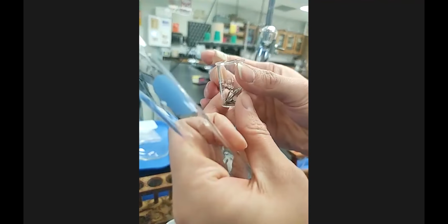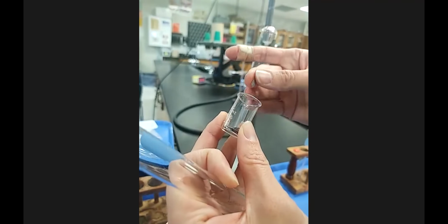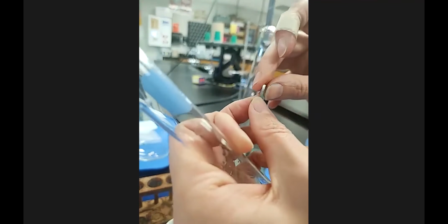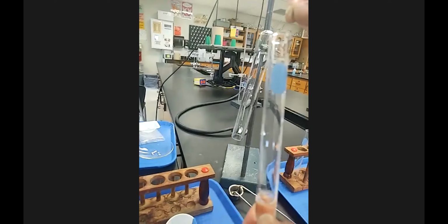All right, so you guys have seen magnesium metal earlier in the lab. So I have my cute little baby beakers. I found the best thing for baby beakers are holding little pieces of magnesium or other solids. Okay, so another piece of magnesium ribbon here. Going to add this to the test tube here.